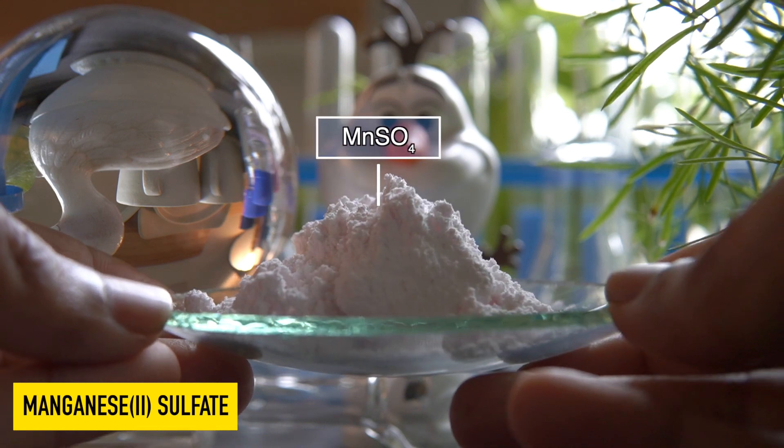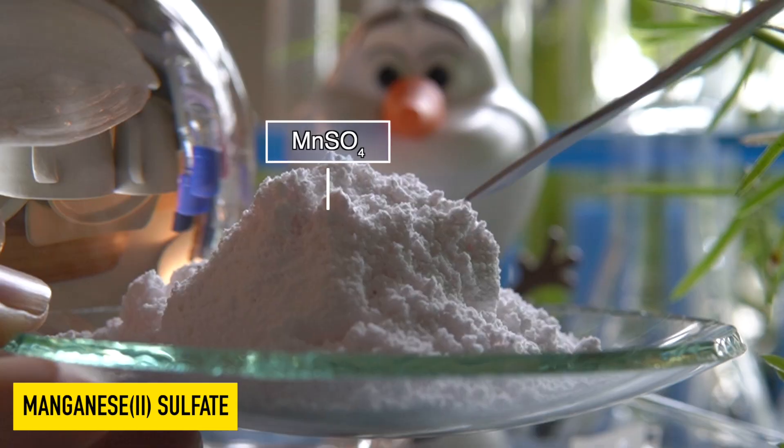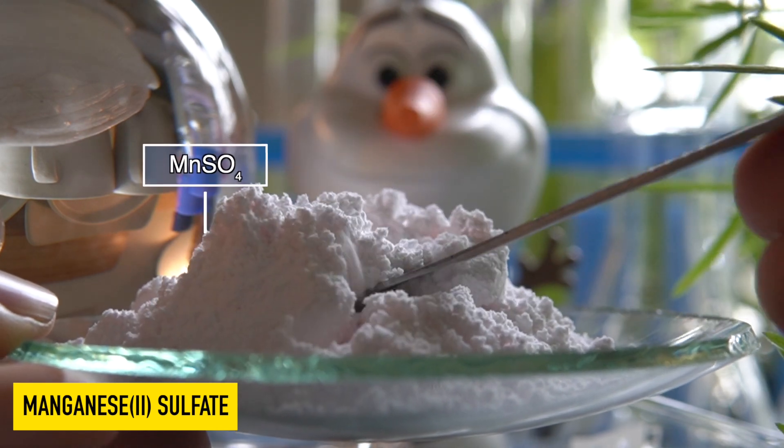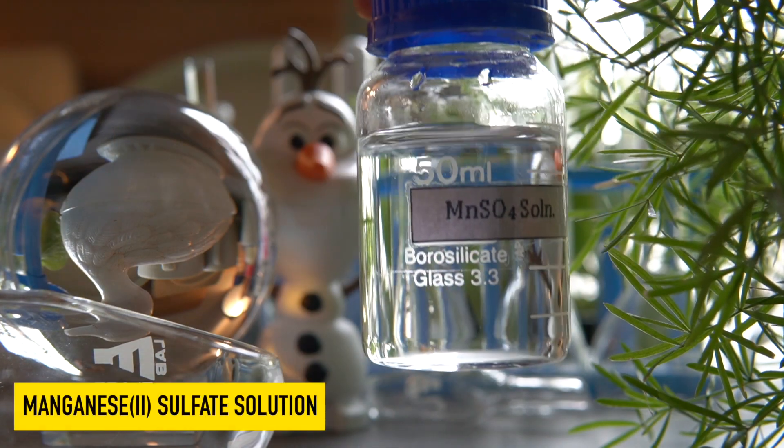This is MnSO4 salt, slightly pinkish in color and highly soluble in water. So it can easily dissolve in water to make a homogeneous solution.